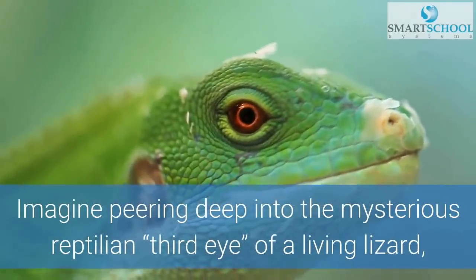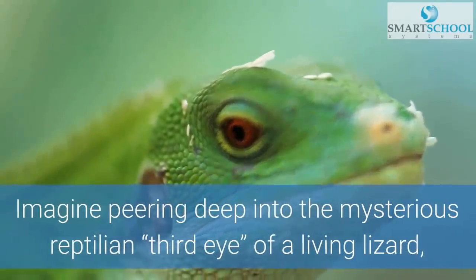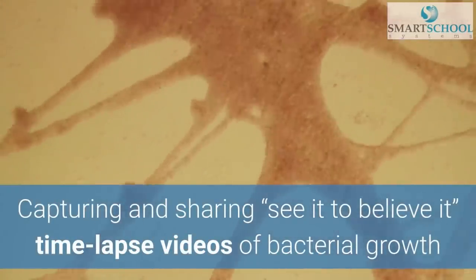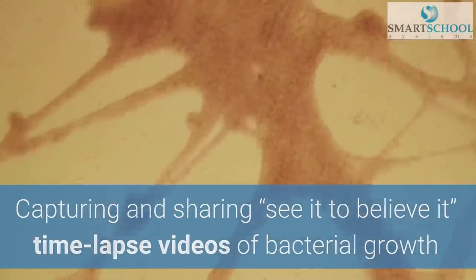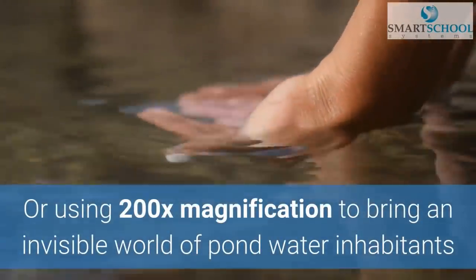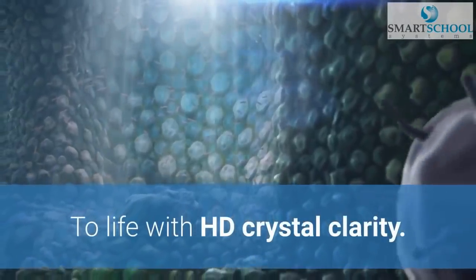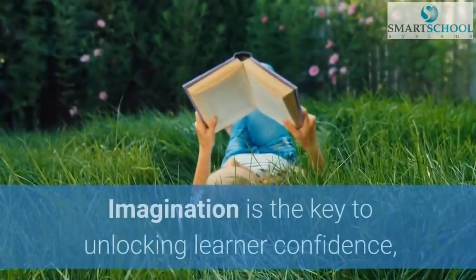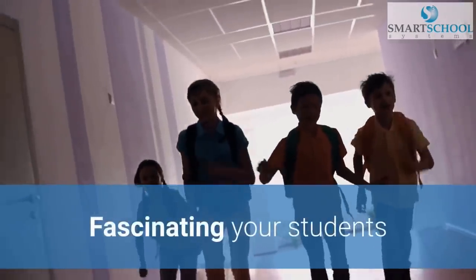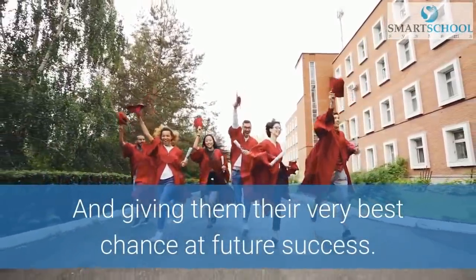Imagine peering deep into the mysterious reptilian third eye of a living lizard, capturing and sharing see-it-to-believe-it time-lapse videos of bacterial growth, or using 200 times magnification to bring an invisible world of water inhabitants to life with HD crystal clarity. Imagination is the key to unlocking learner confidence, fascinating your students, and giving them their very best chance at future success.